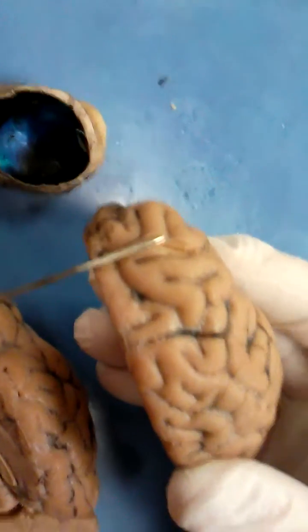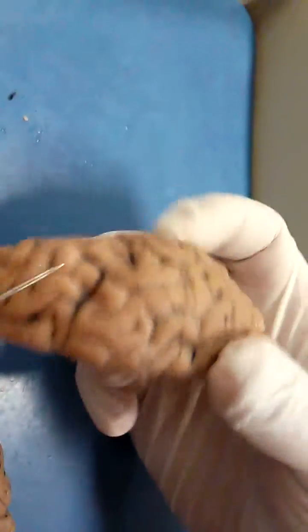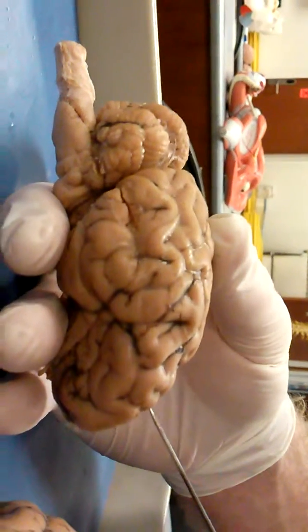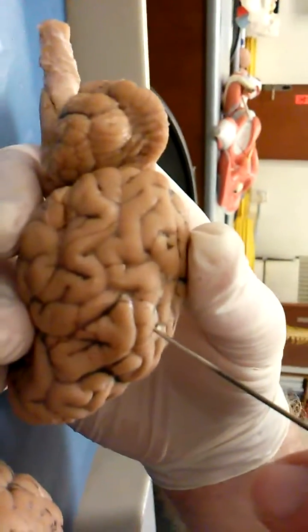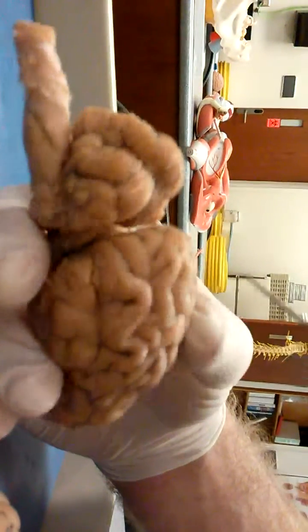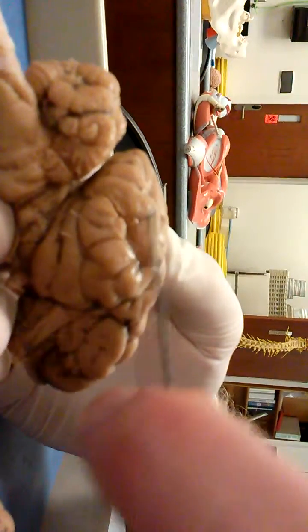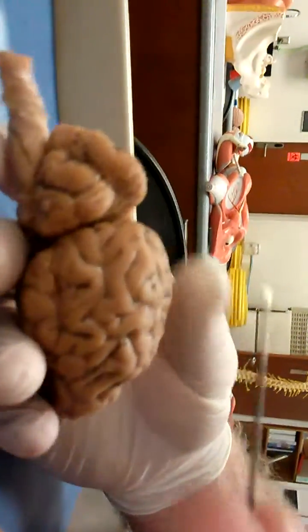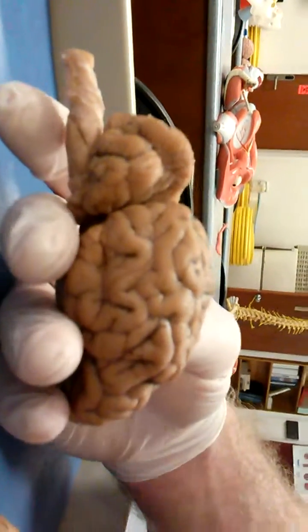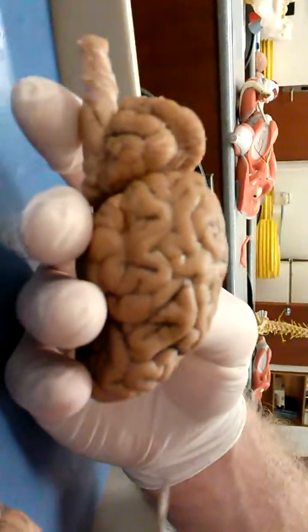Frontal lobe — this is the front of the brain. Parietal lobe. Occipital lobe. Temporal lobe, which you don't have to know, but it's included anyway. This whole top part is called the cerebrum — all the squiggly stuff on top of the brain. One half of the cerebrum is called a cerebral hemisphere, so there are two hemispheres.